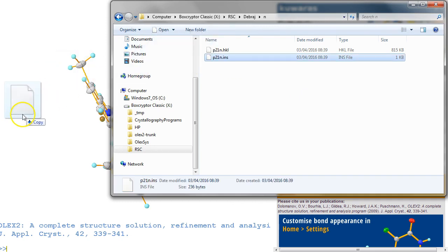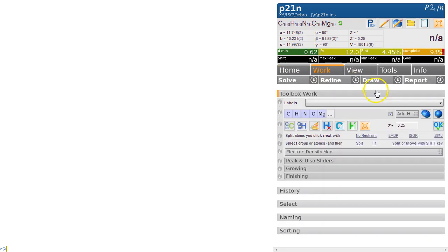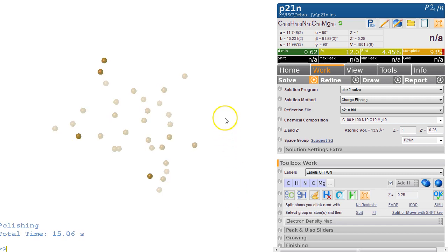So we're dragging this into Olex2 and we see what we get. We shouldn't get anything because there's nothing solved yet. So we've got a tentative formula, we've got very good data, we've got a cell, so that looks great. So let's solve it. Olex2 solve, we can try superflip or Olex2 solve. Let's stick with Olex2 solve for the moment, and we hit solve. And that will take a little bit of time to run, and here's the output. What you're looking for is this number, which should become bigger and bigger and bigger. And if it doesn't, this particular program will not solve it, but it has solved it.